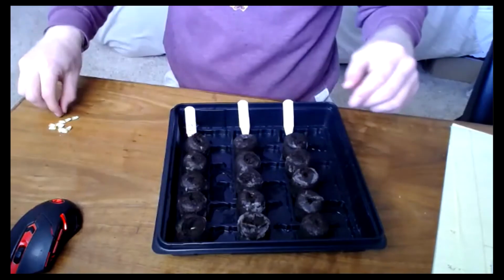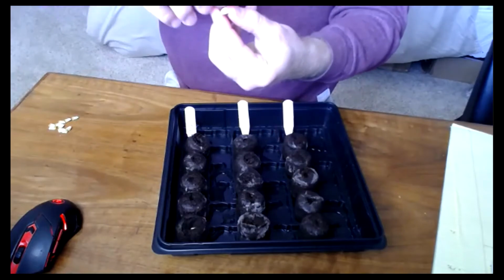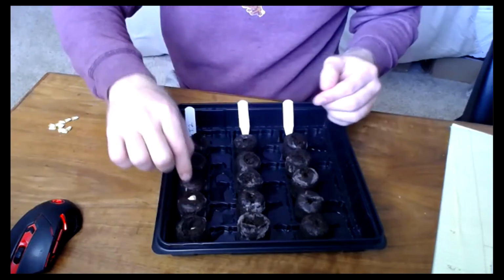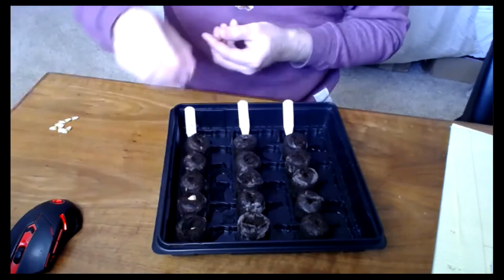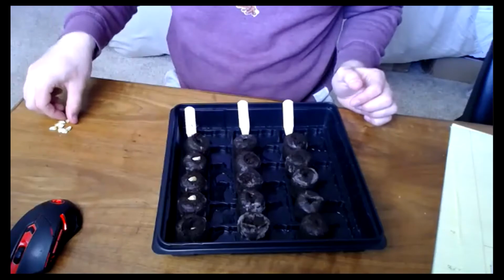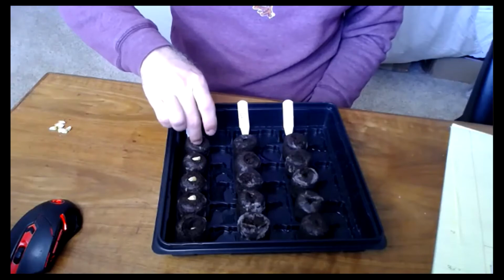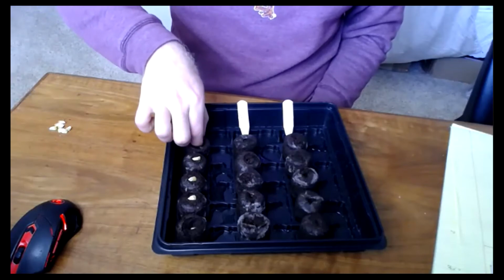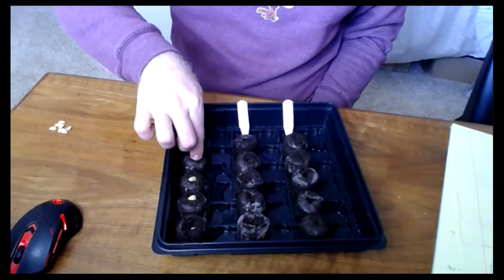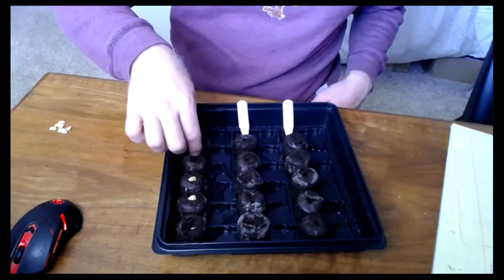Oops. Making sure that embryo is facing the same way. So it's embryo facing, I guess, the camera at this point. Placing that in. I'm going to do that for all 5 of these within this row. So now that they're all there, I'm just going to press them in. My best to make sure that they all fit that same sort of description that we see in table 2 of the paper posted for treatment 2.